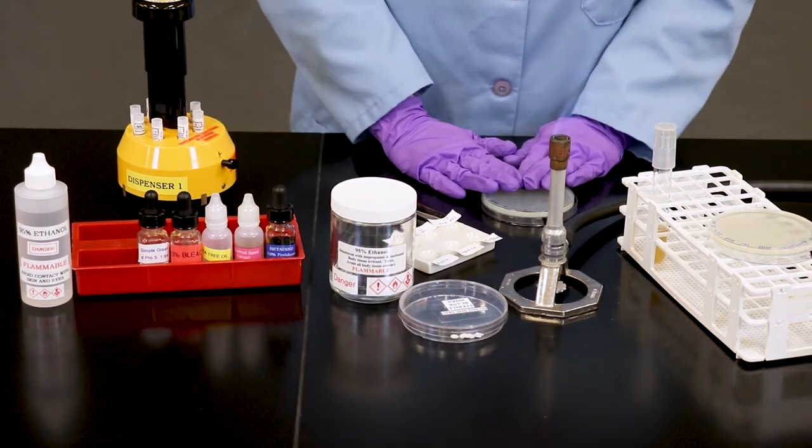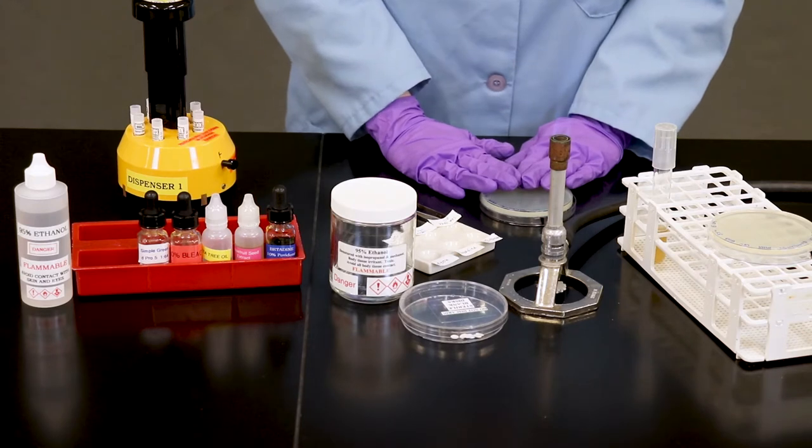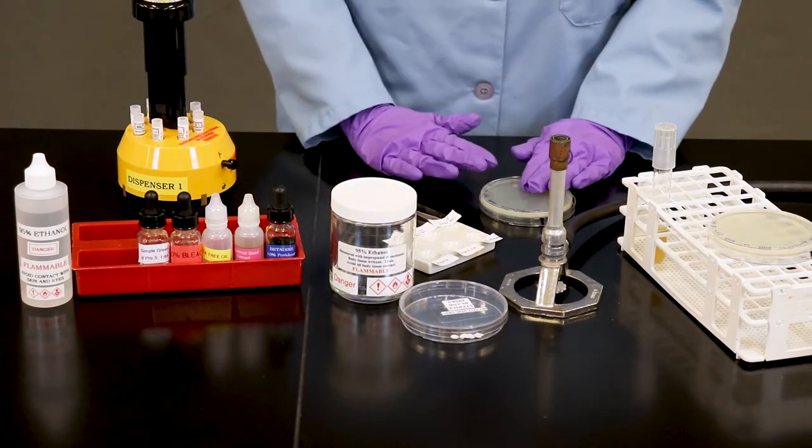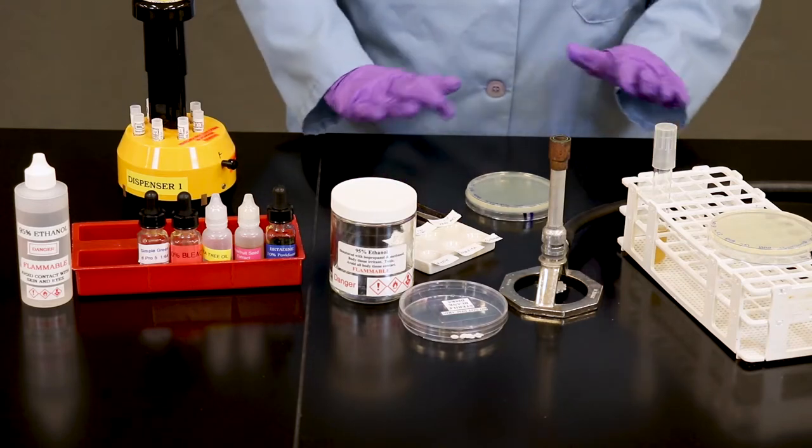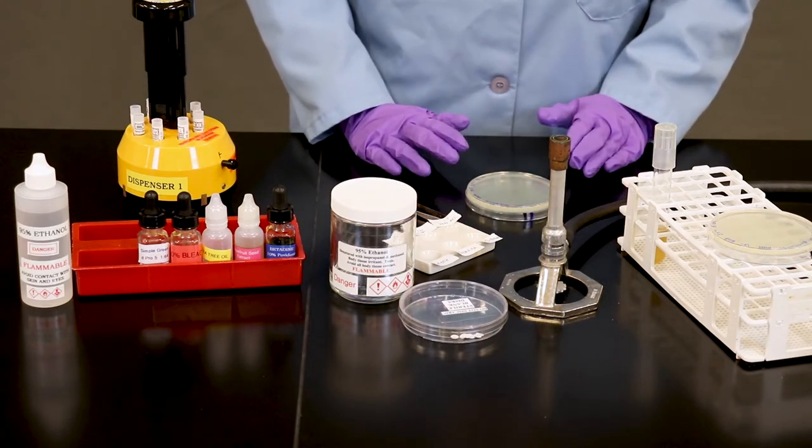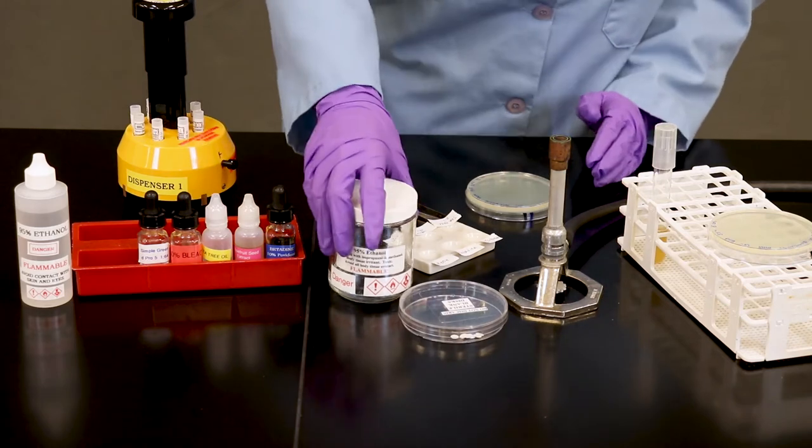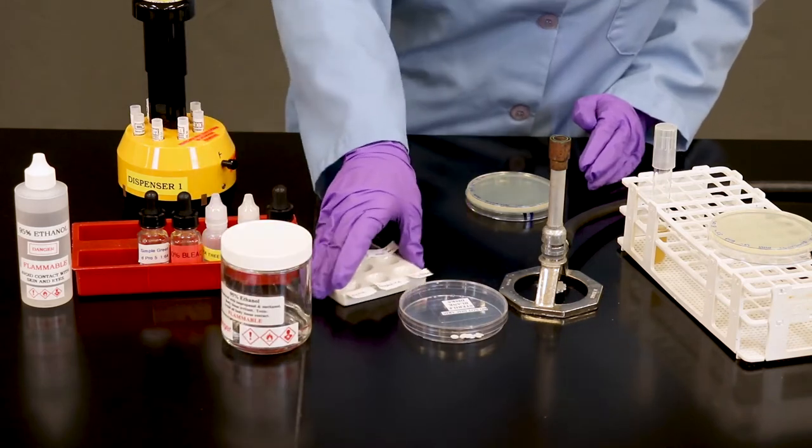Let's start with the antibiotic plate. This one's very simple to do. Once you've had your petri plate fully inoculated with your bacteria, typically, depending on how well you saturated it, you might want to let it dry just for a few minutes. But essentially, bring this to your instructor and they will help you apply the antibiotics like so.